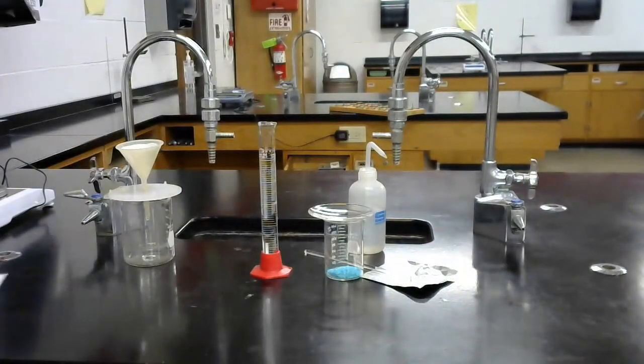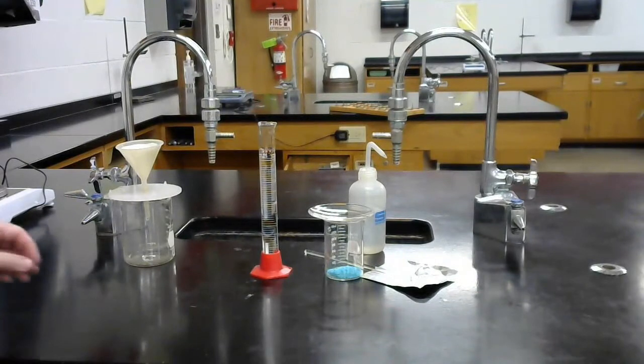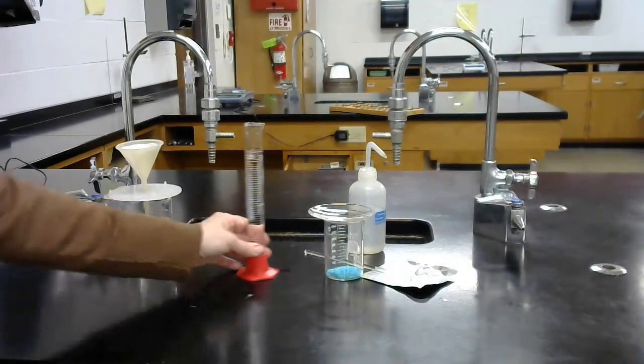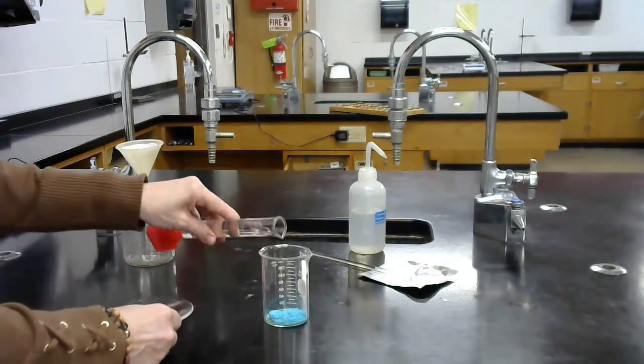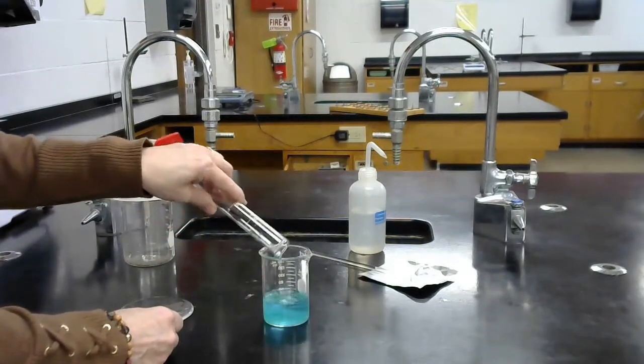In the rest of the slideshow, you should see my data that I collected. So I have my copper chloride in my beaker. I'm going to add the water to get this to dissolve.